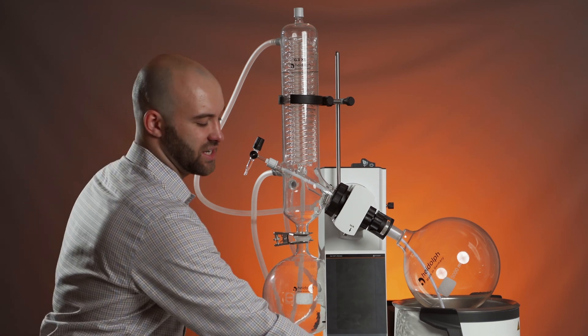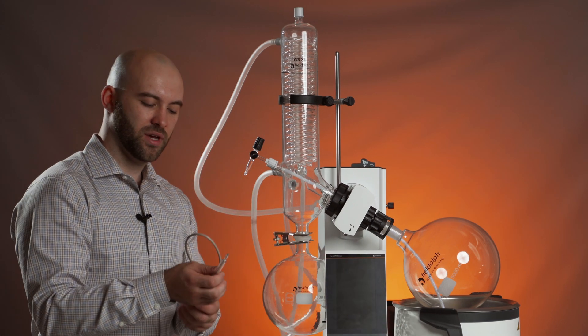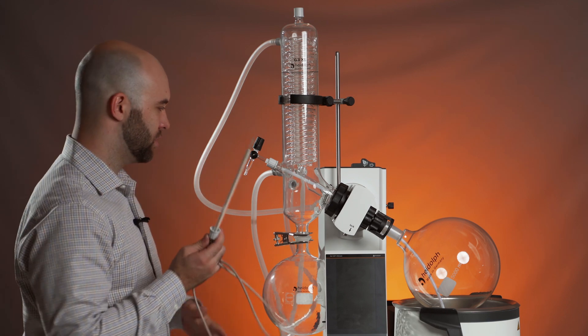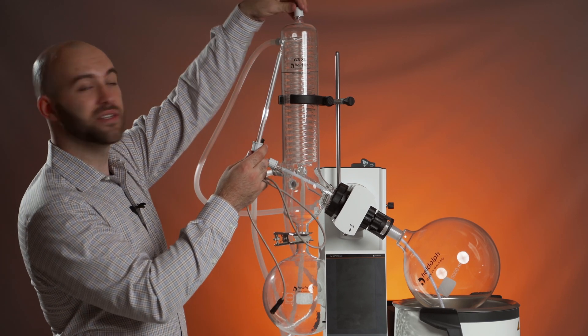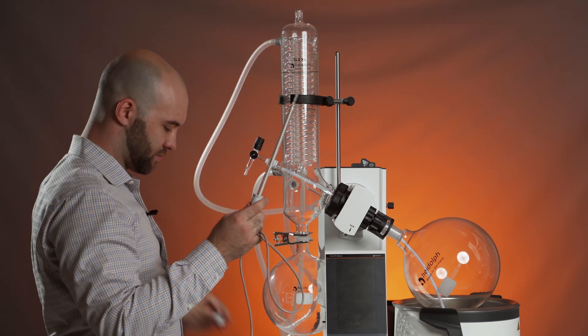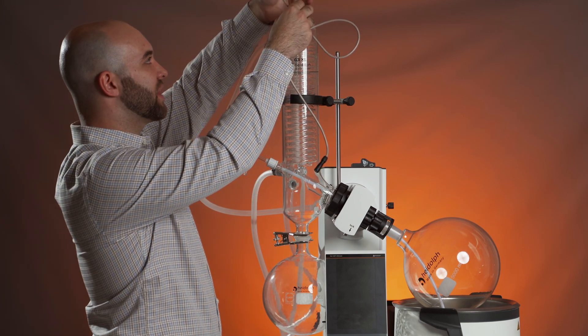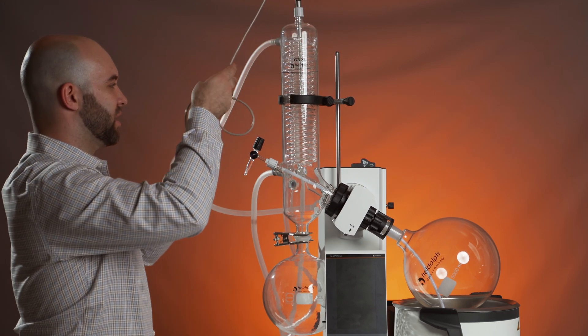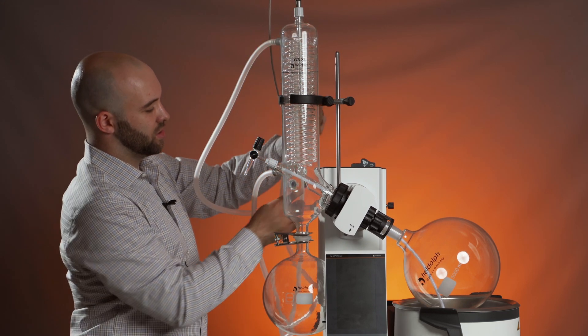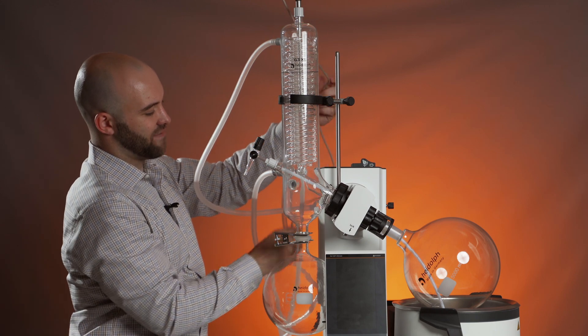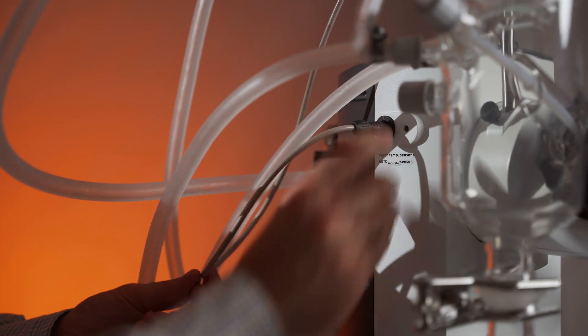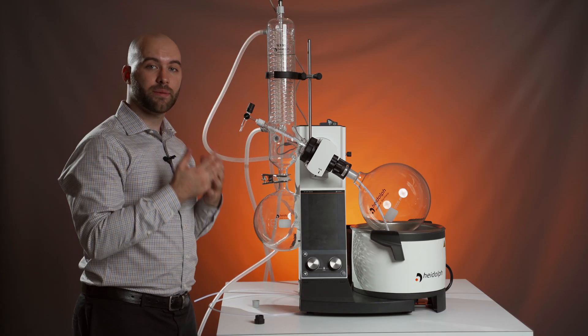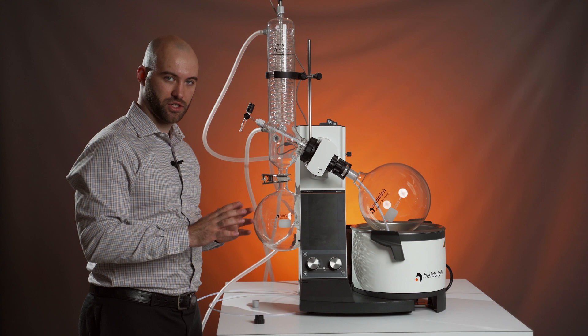The second most commonly used accessory with our HiVap is the auto-accurate sensor. This sensor will replace this GL18 cap up here, slide through your coils, and plug in to the side of your HiVap drive. What this sensor enables is automatic evaporation through our dynamic auto-accurate function.